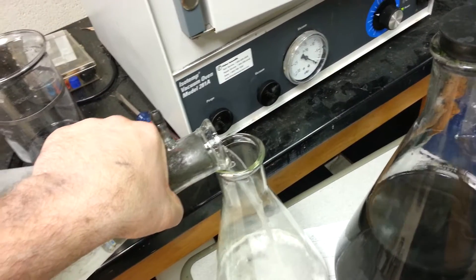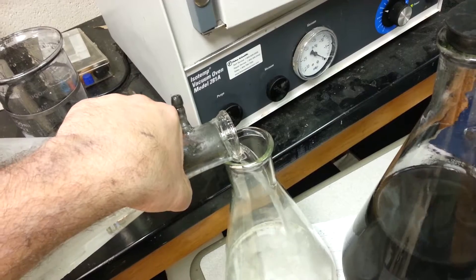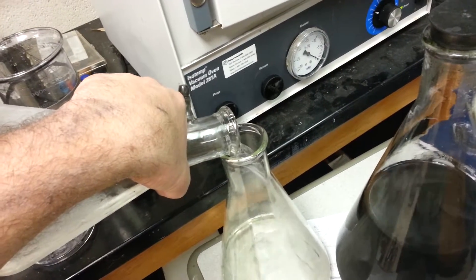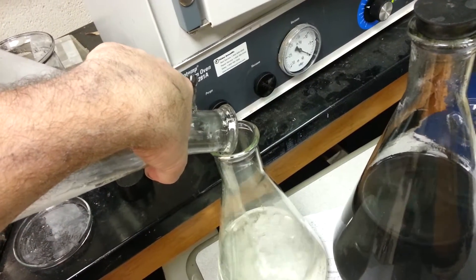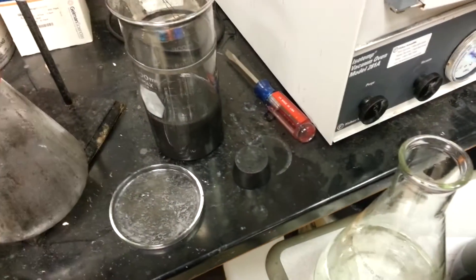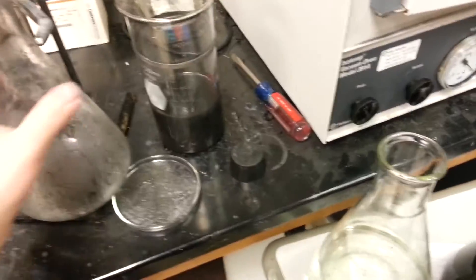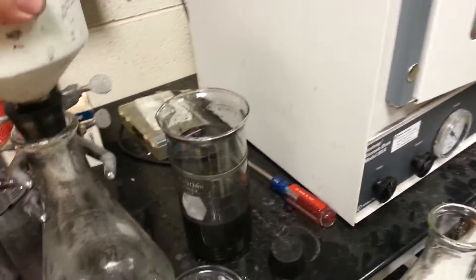This is the magic solution. I won't tell you what it is because, quite frankly, it's patented — we have a provisional patent on it. It's still not a good idea to just give this stuff out. There's a couple different things in there. But there you go, and then you just go over like this.